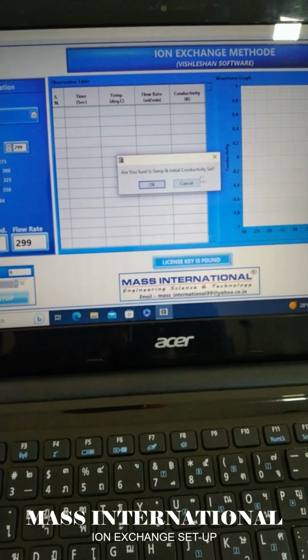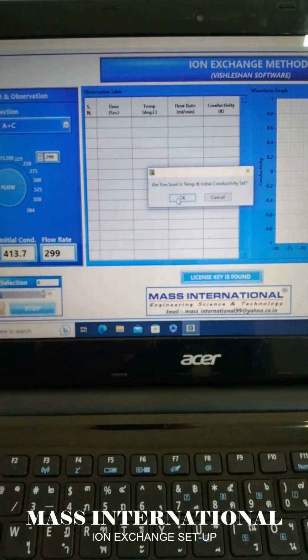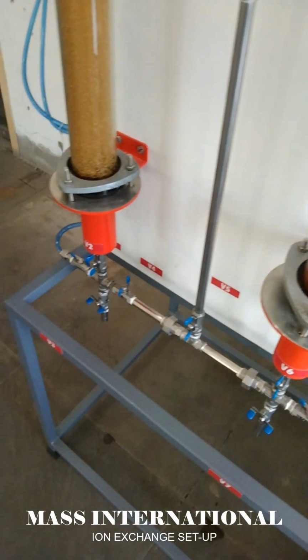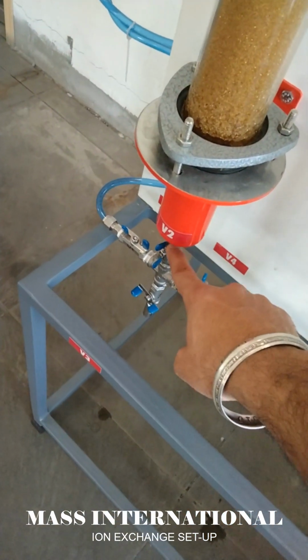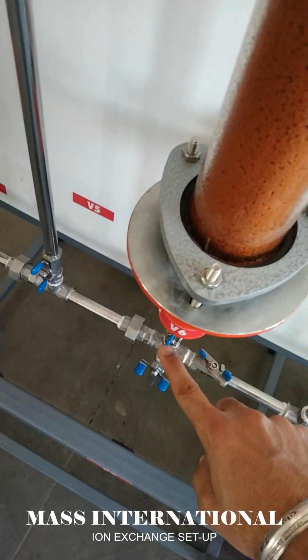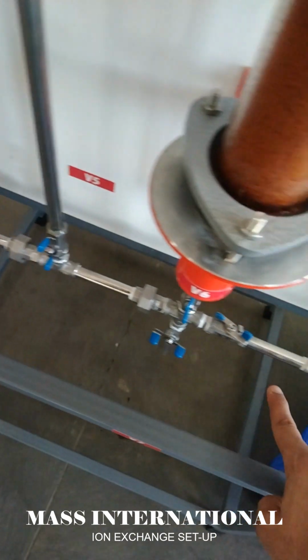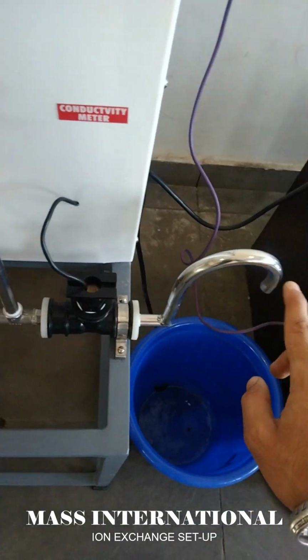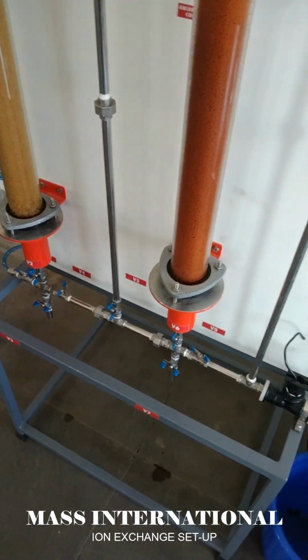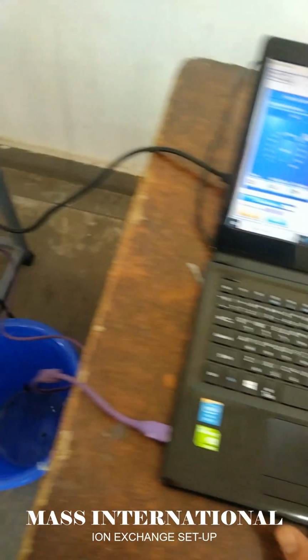One pop-up is generated: are you sure that the temperature and initial conductivity are set? You have to check the initial conductivity by opening and closing the valves. Like this valve is closed, water will not enter the column, and this valve is also closed, water will not enter the column. And these valves are open so that the initial water flows through the conductivity meter, and we check the initial conductivity of the water.